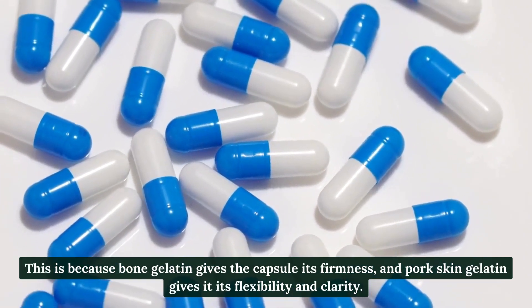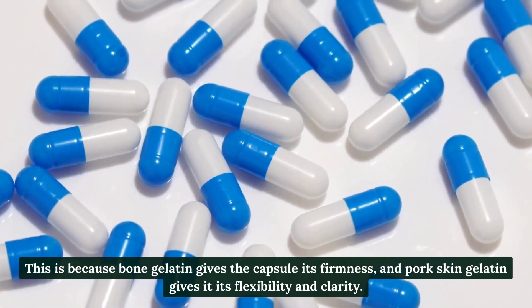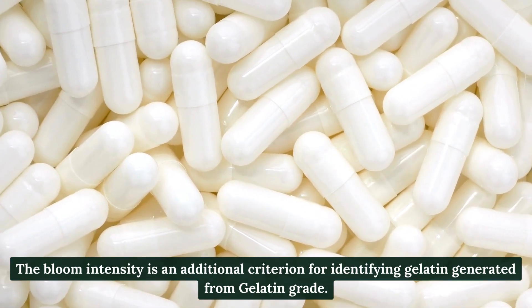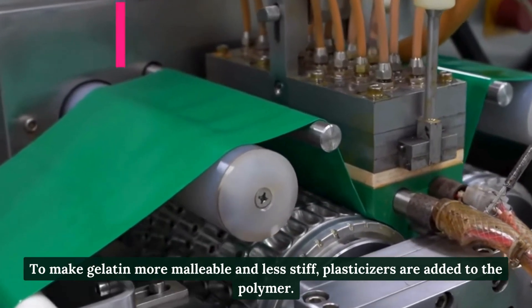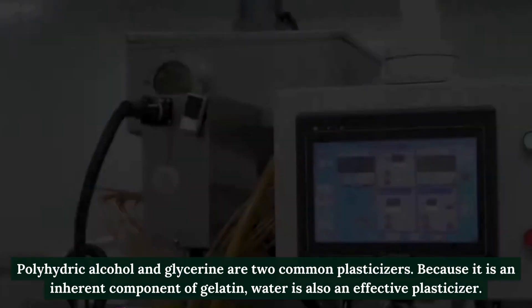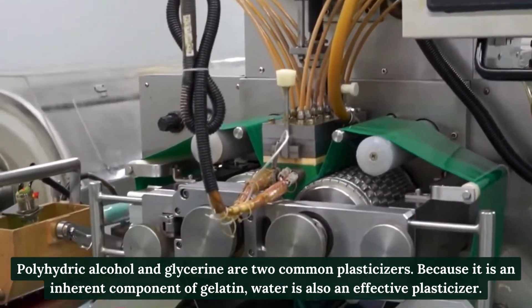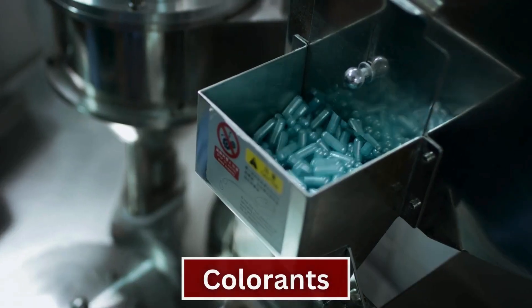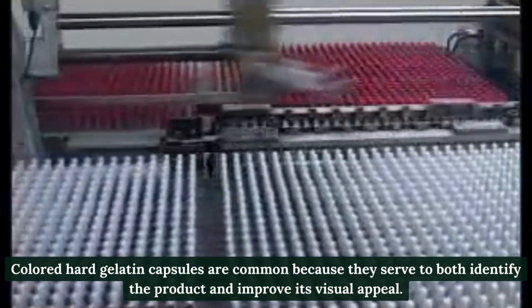Bone gelatin gives the capsule its firmness, while pork skin gelatin gives it flexibility and clarity. Bloom intensity is an additional criterion for identifying gelatin grade. Plasticizers are added to make gelatin more malleable and less stiff — polyhydric alcohol and glycerin are two common plasticizers. Water is also an effective plasticizer, as it is an inherent component of gelatin.